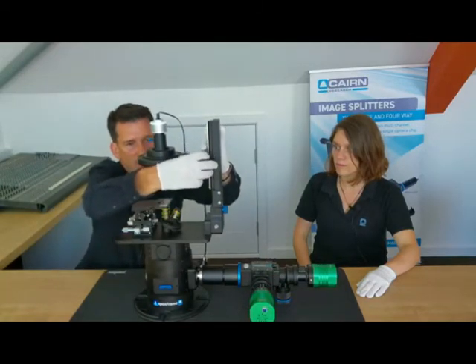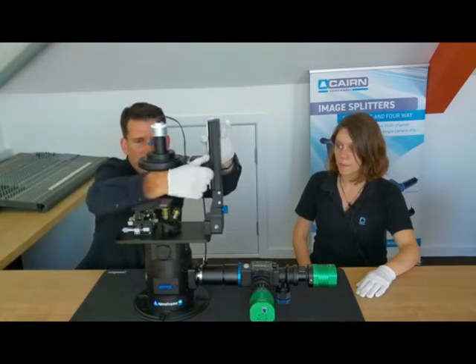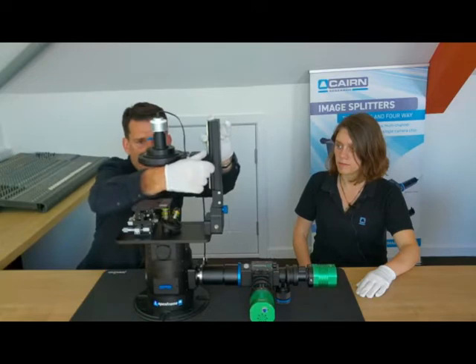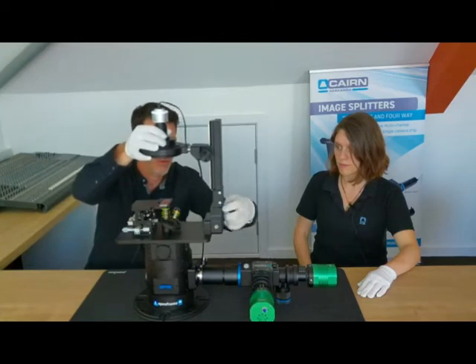So if we come in close, we get dark field. If we move further away, we get bright field, then phase, and then bright field towards the centre of the objective. And we can provide more. Please contact us if you want more information about the Aura phase contrast illuminator. We've also included a standard transmitted LED for the middle, so you can use other techniques. The pillar folds out rather nicely.